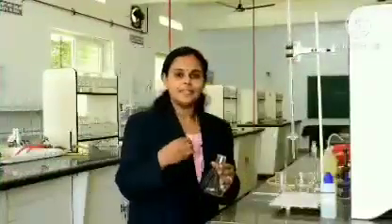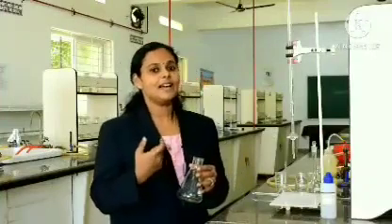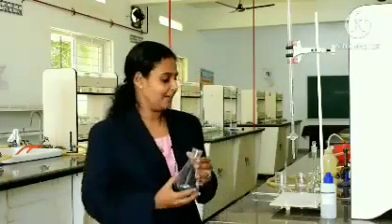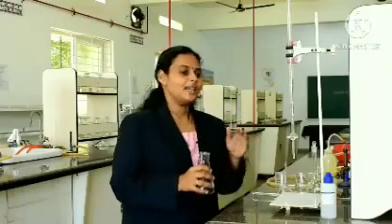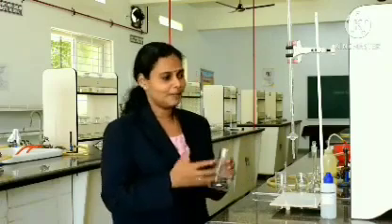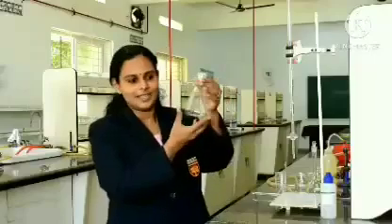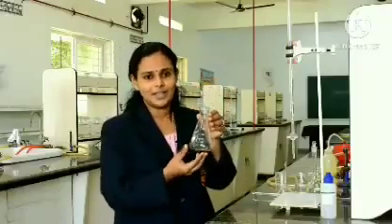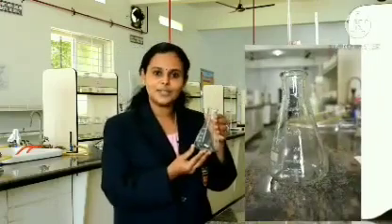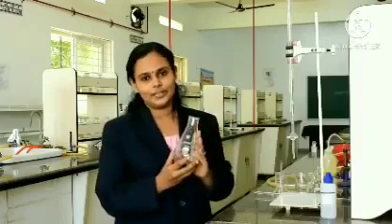The experiment in volumetric analysis, we call it titration. This word titration will be new for you, but it is an important term, so just keep that in mind. Now first of all, let us get familiarized with the apparatus used for volumetric analysis. The apparatus required are, the first one which you could see is a conical flask, which I think all of you will be familiar with. This is a conical flask just to take the chemicals in it. The experiment is generally conducted in this conical flask.